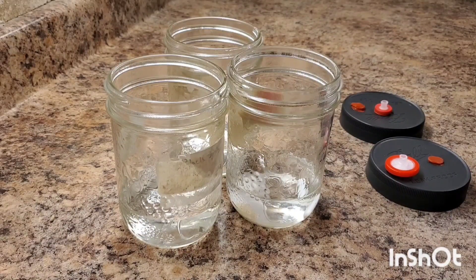You could technically pre-mix your liquid and sugar and heat it up in a pot to dissolve everything, but I feel like that's completely unnecessary because during the pressure cooking process the liquid is going to be heated up to that temperature and everything is going to dissolve. So this is a nice little way around it.